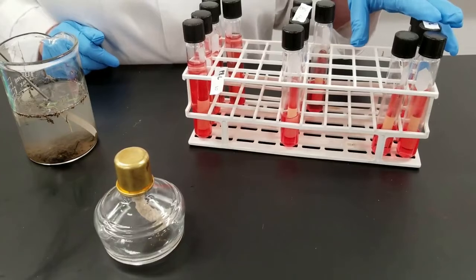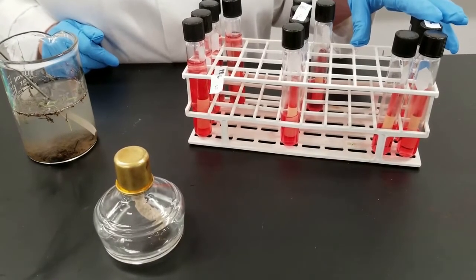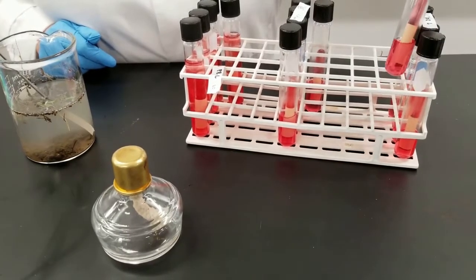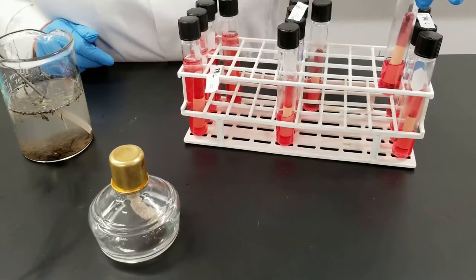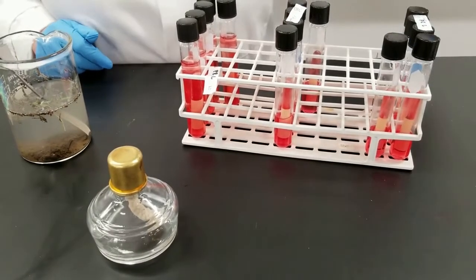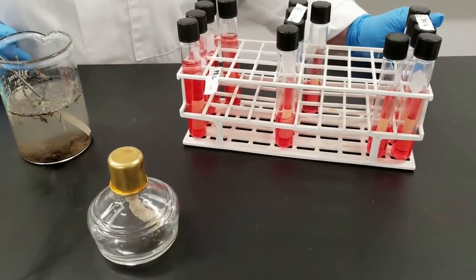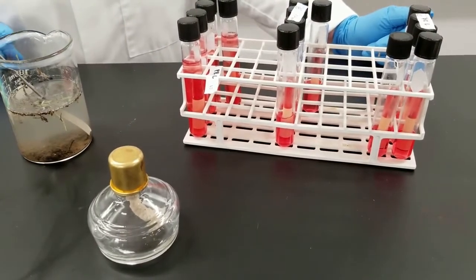We're going to incubate these for 24 hours at 37 degrees C. You can see how it looks. Like I say, I just inoculated them. They have the Durham tube in it. We will see if gas is produced. Has the phenol red pH indicator in it, so we can see if acid is produced. And we can compare at these 3 different dilutions.